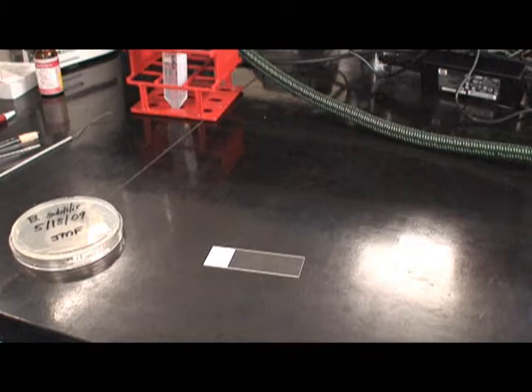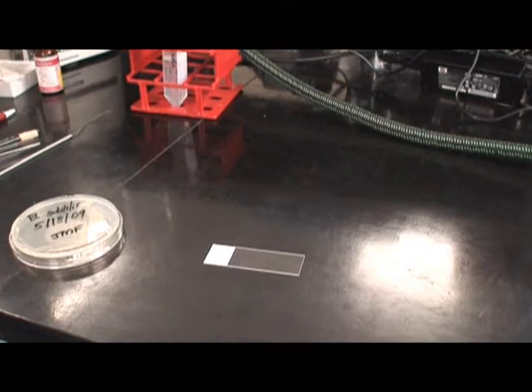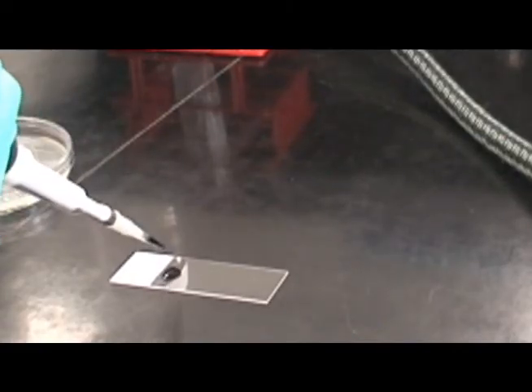The negative stain. As done in other stains, obtain a glass microscope slide and pass it through a flame to sterilize it. At one end of the slide, aseptically transfer a small drop of 10% nigrosine.